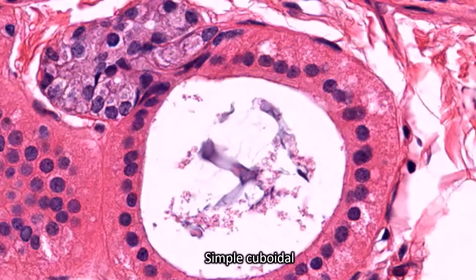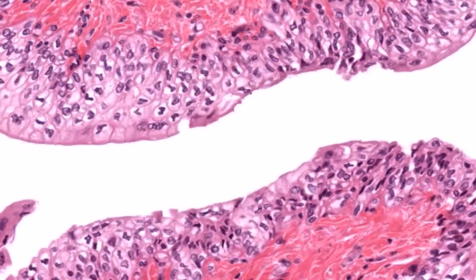One layer of circular nuclei should tell you it is simple cuboidal. This is transitional epithelium because you've got multiple rows of nuclei, so you've got multiple layers of cells. We know that it's not keratinized stratified squamous because we don't see the flaky top.